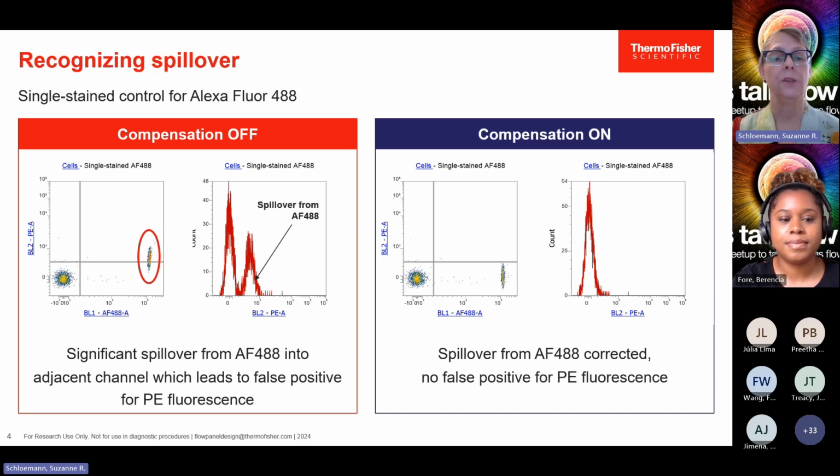And you can see that on a histogram as well. Here you can see a second peak. On the second peak are the events that are in this double positive quadrant. Now this is only stained with Alexa 488, so we shouldn't have any double positives. When we perform compensation, you'll see that the fluorescence intensity of this population has been lowered to be equal with the unstained cells. As a result, the second peak is no longer there, so we no longer have false positives in our data set.